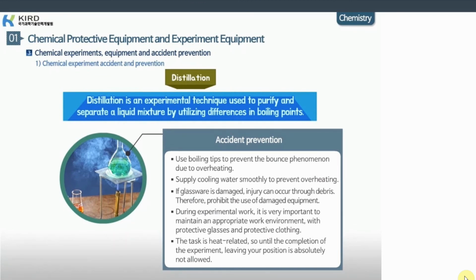It is important to prevent accidents. Use boiling tips to prevent the bounce phenomenon due to overheating. Supply cooling water smoothly to prevent overheating. If the glassware is damaged, you can be injured by debris. Therefore, prohibit the use of damaged equipment.